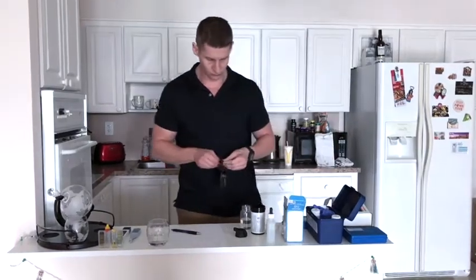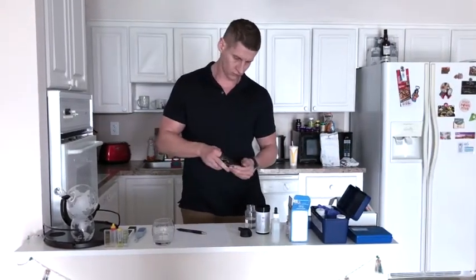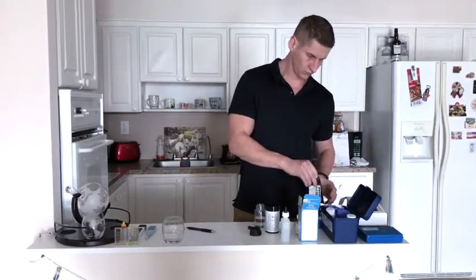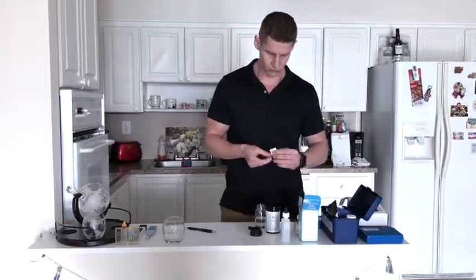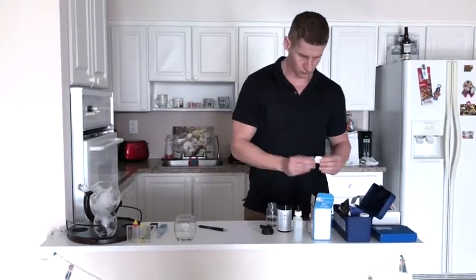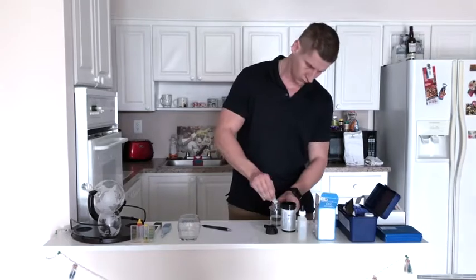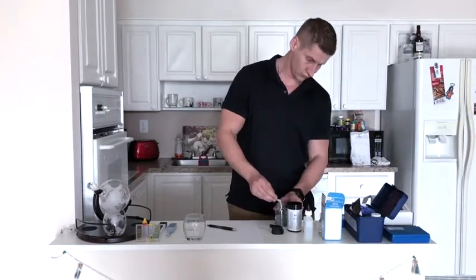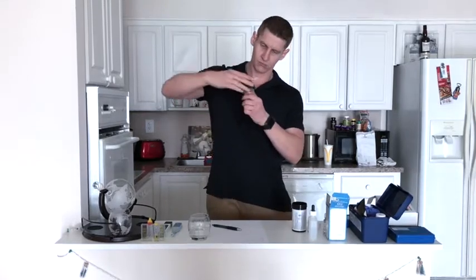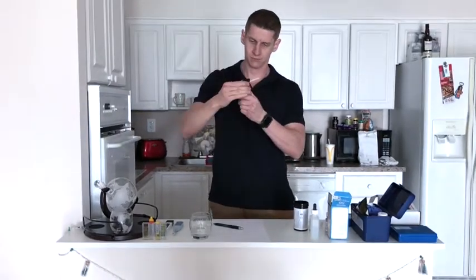The next test reveals the number of phosphate, nitrites, and nitrates, heavy oxidants that are harmful to humans and have been found to have short-term and long-term health effects. Even though there are several studies pointing out that nitrates could increase risk of cancer, any presence of these chemicals can be harmful. All tests are positive.